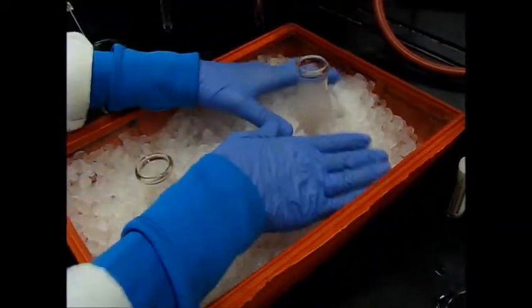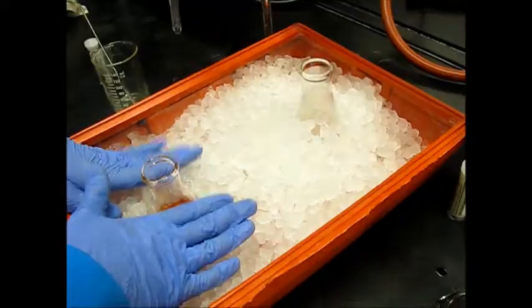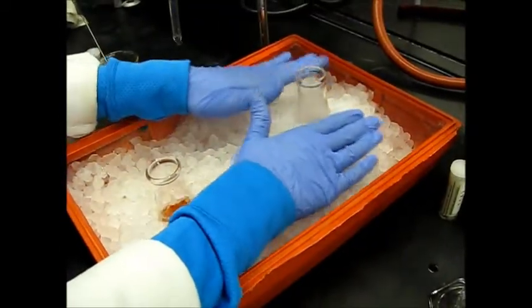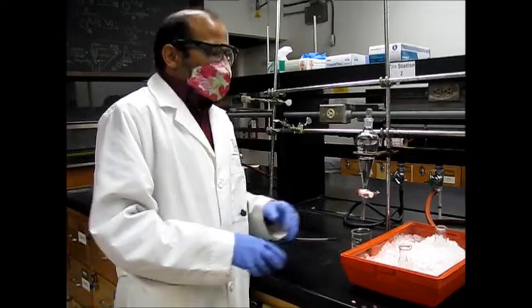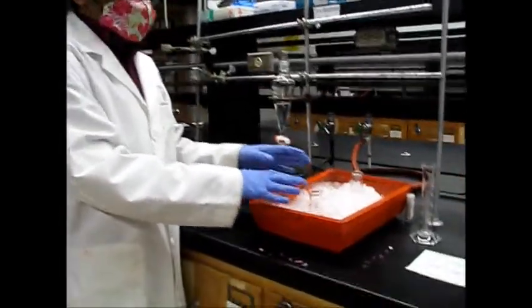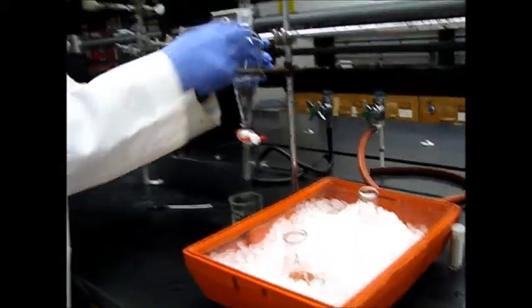Now it's bright red. So wait for some time. Meanwhile you will do the cleaning. Wait for the precipitate to form. So once your extraction is done, all your acidic and basic, then ether layer.